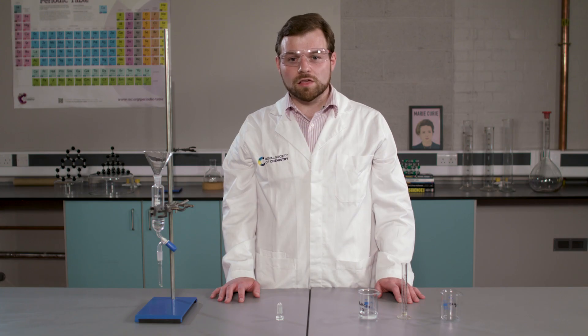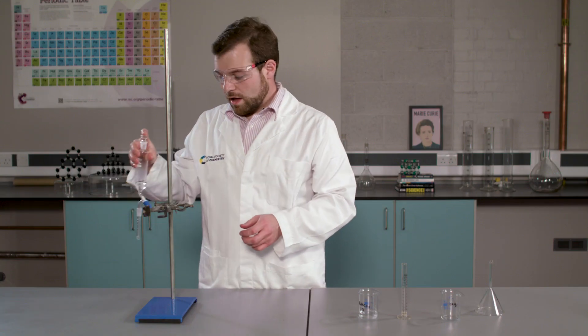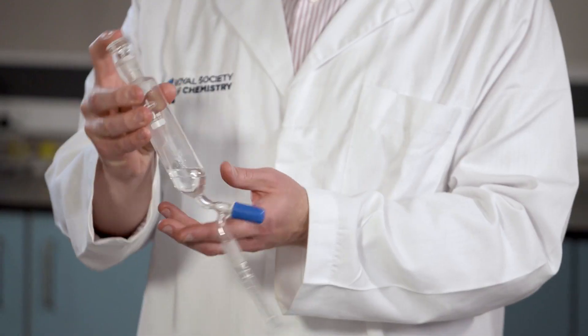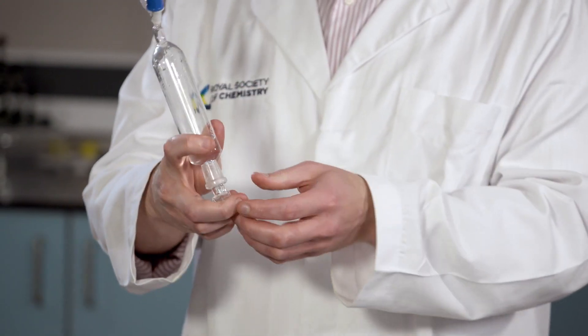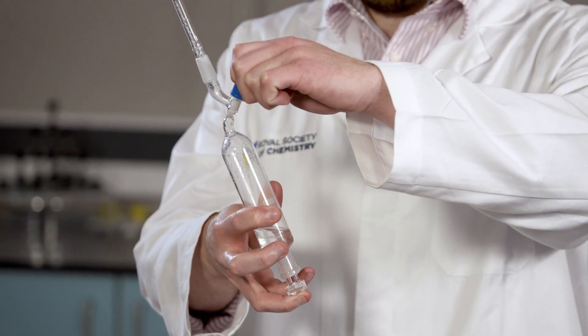I now need to mix this, so I'm going to put the stopper back into the flask and invert it. As I invert the separating funnel, I'm going to keep my finger on the stopper. I'm now going to open the separating funnel. This allows gas to escape.